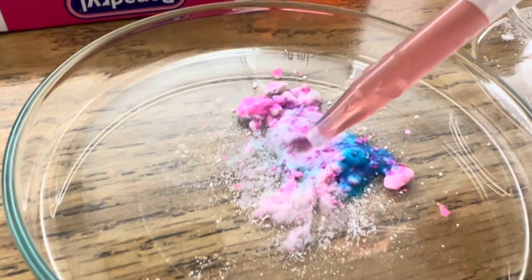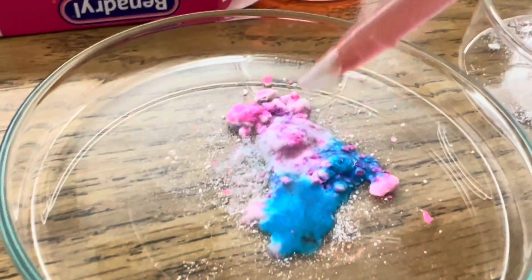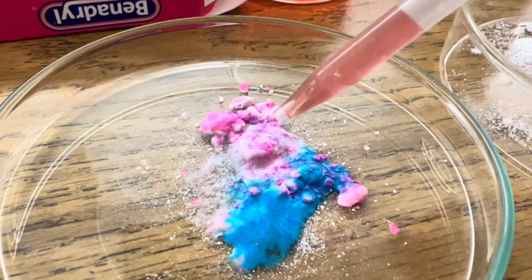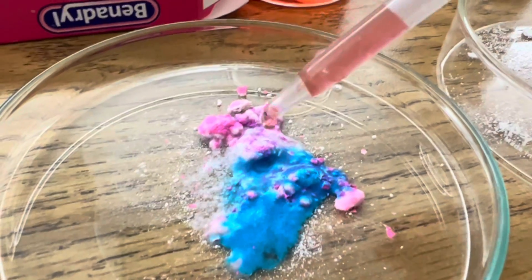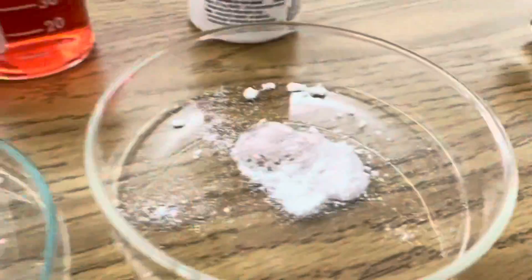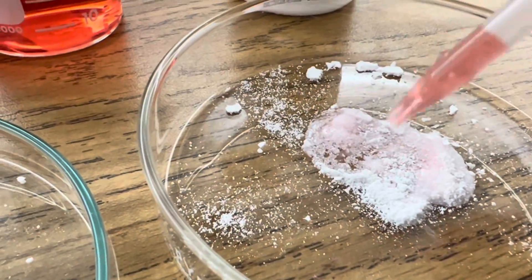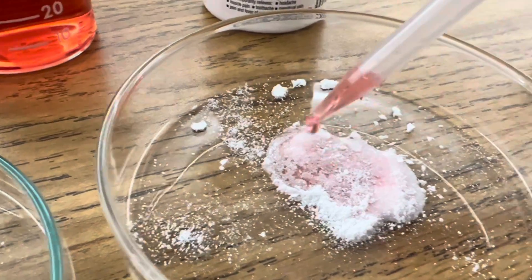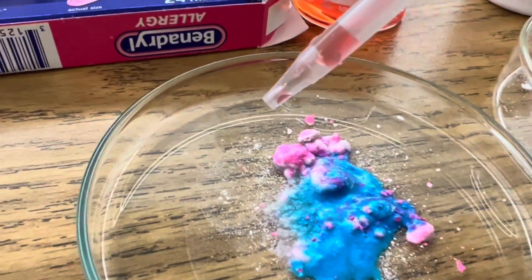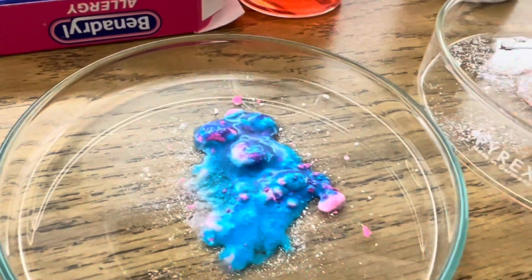Oh yeah. Look how blue that is. Huge color change. Now look at it on the aspirin — little to no change at all. But man, on the Benadryl it really shows up.